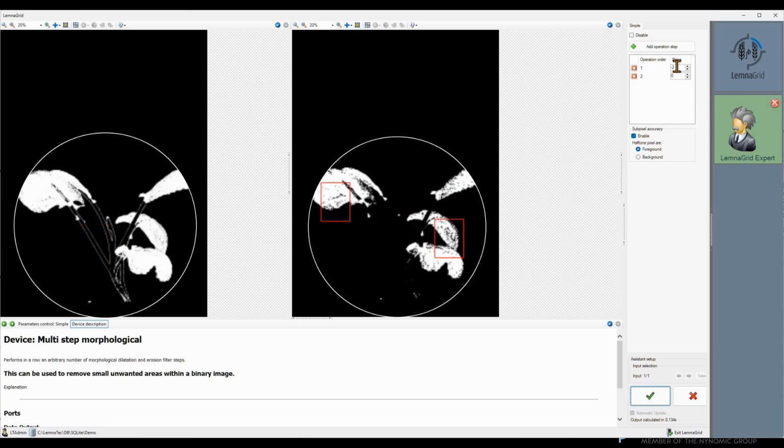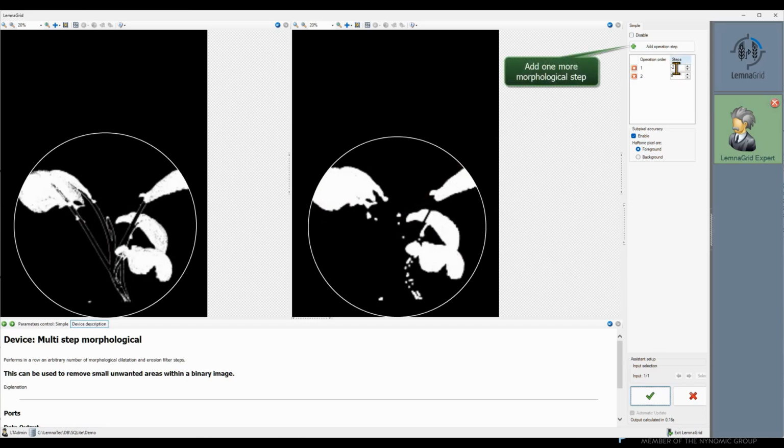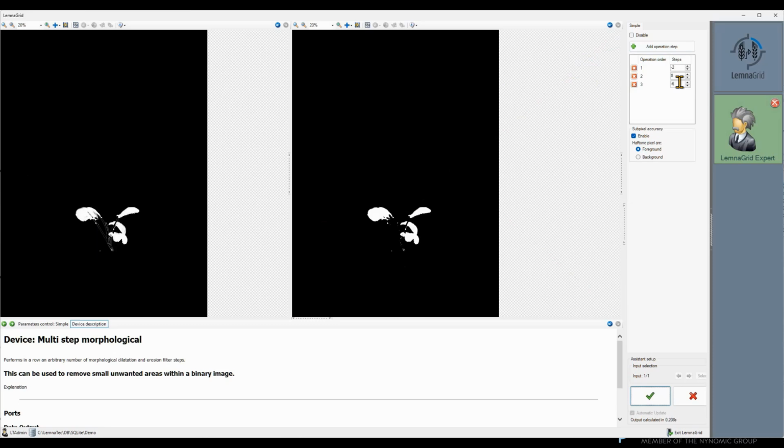Now we want to get rid of the holes in the leaves. We add an 8 subpixel dilation. Finally, we have to return to the original size by adding another erosion of 6 subpixel. The result is almost what we would like to see, but there are a few patches left. We can handle them using the fill areas device.